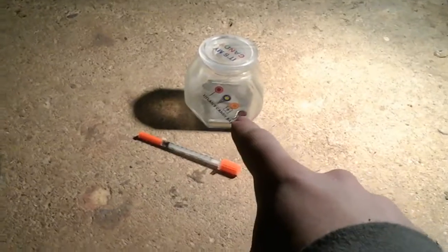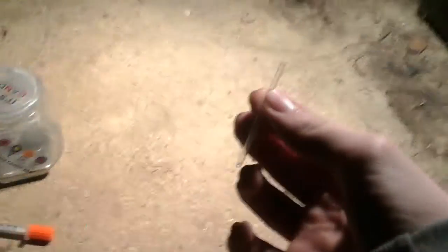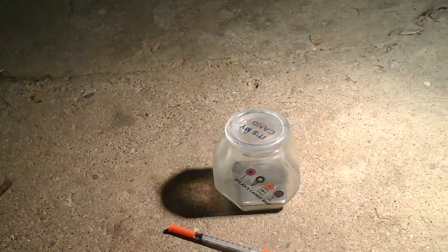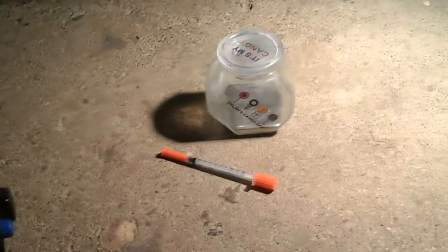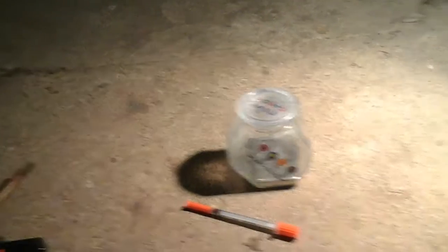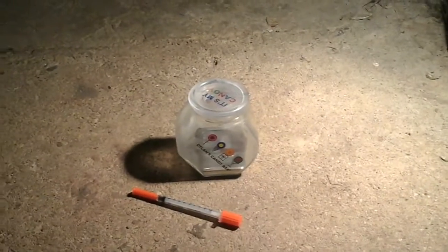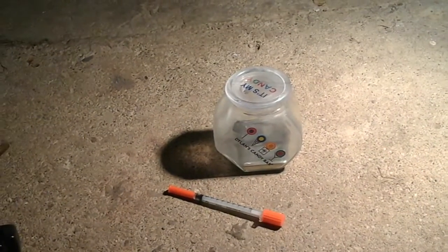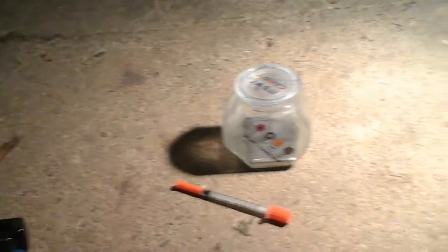In this video I'm going to be taking my purified mercury, sucking it up in a syringe, and I have this tiny glass tube from a glow stick — I just cut it open and cleaned it out. There's peroxide inside that reacts with the other chemical and makes it glow, but that's not what this video is about. My YouTube friend Nevin's Lab stored copper and other things inside his ampule, and that's where I got this idea. What I'm going to do is seal mercury in it.